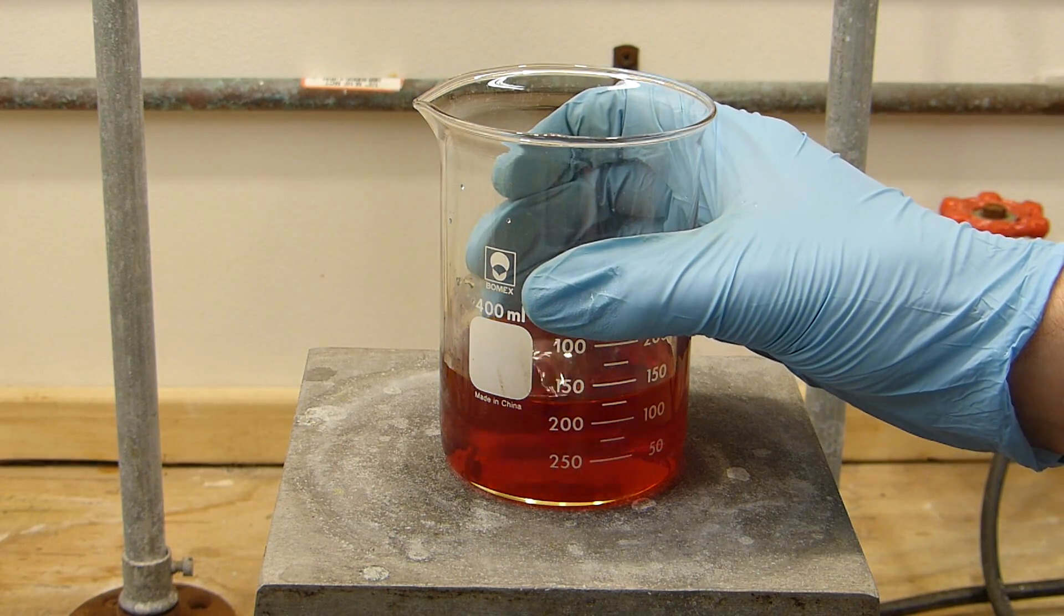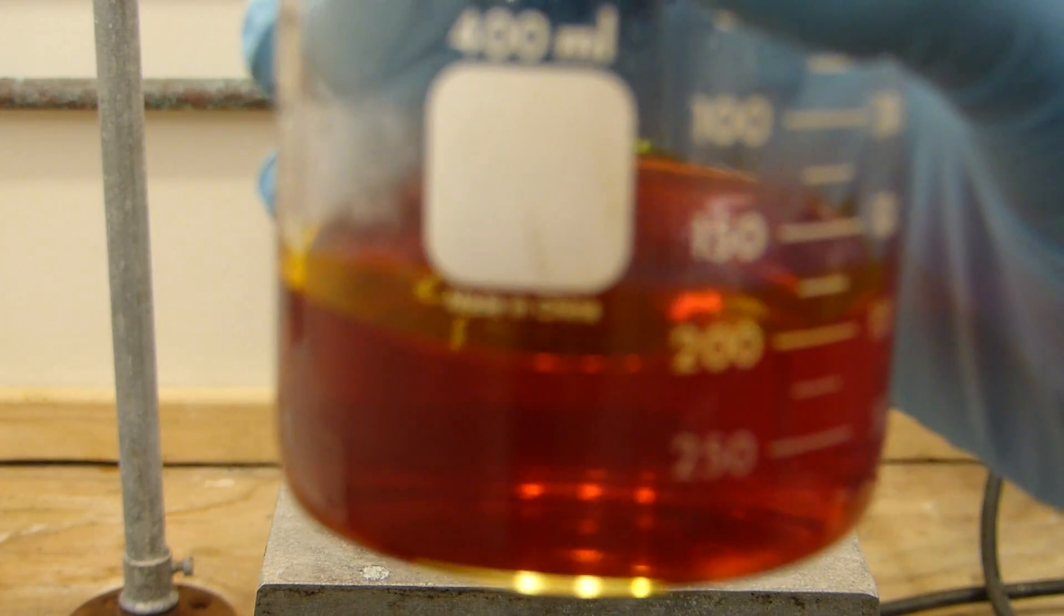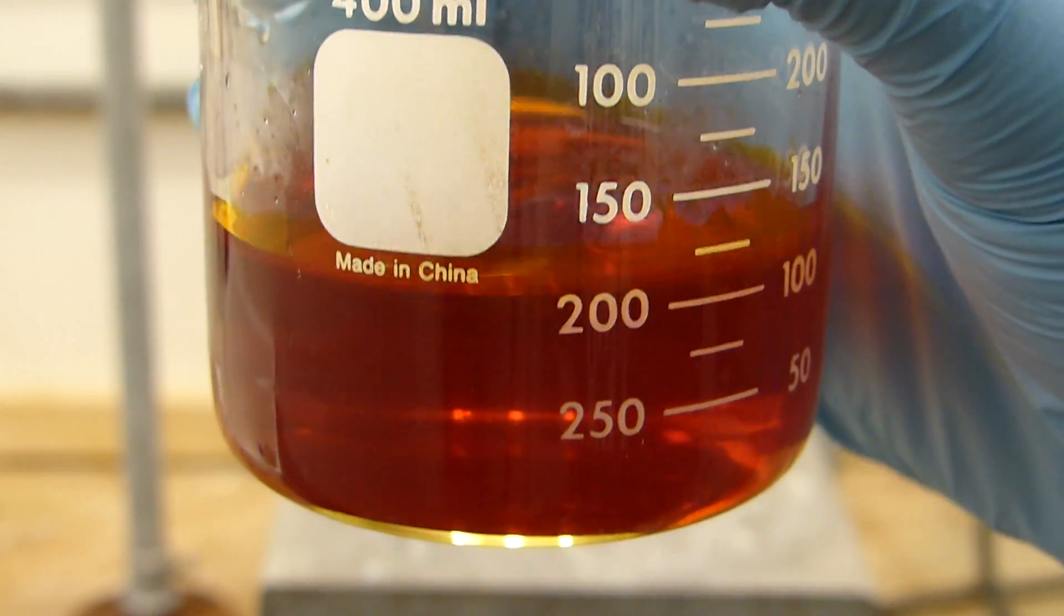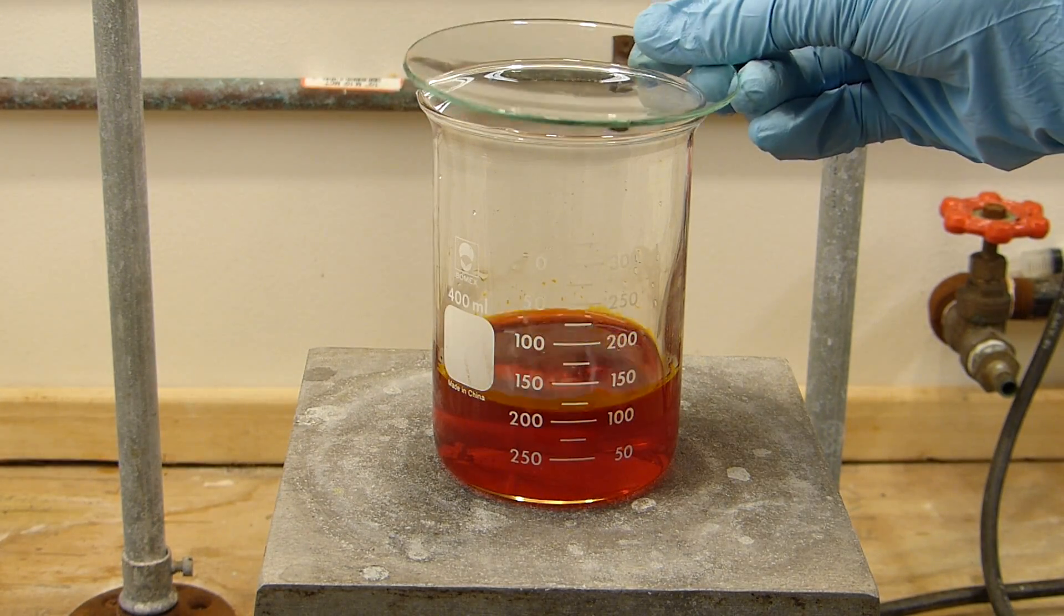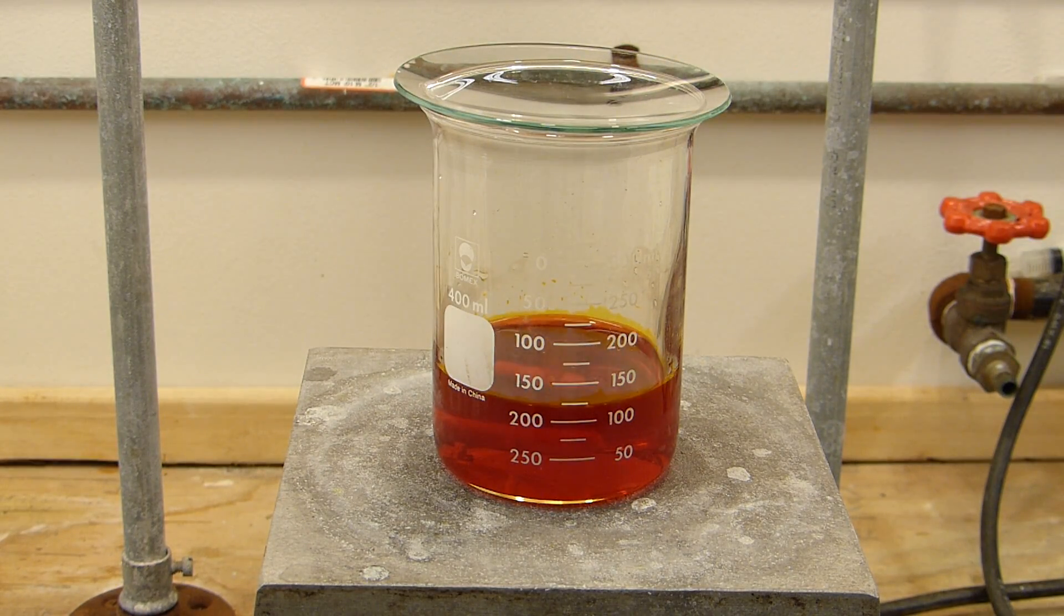All right everything has now dissolved and you can see that we now have this sort of homogenous cherry red orangish liquid and I'm just going to cover it really quick with a watch glass to prevent contamination and stick it in the freezer. I'm going to cool this down to about zero Celsius.